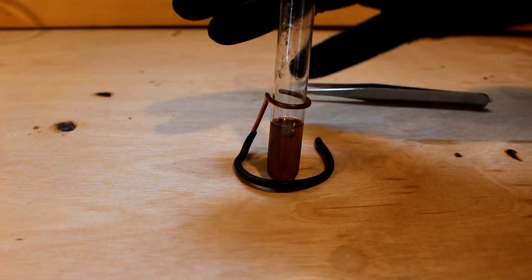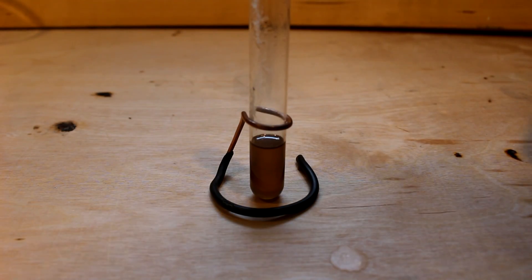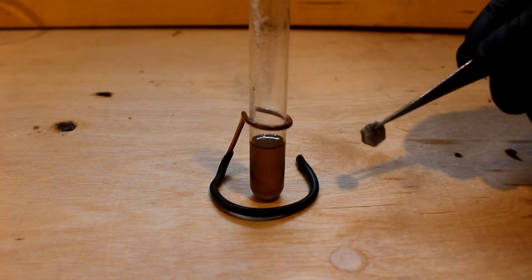That is cool. Almost lost it there. Excellent. Let's see what else it'll float. Diamond has a density of about three and a half grams per cubic centimeter. And this piece of corundum has a density of about four.